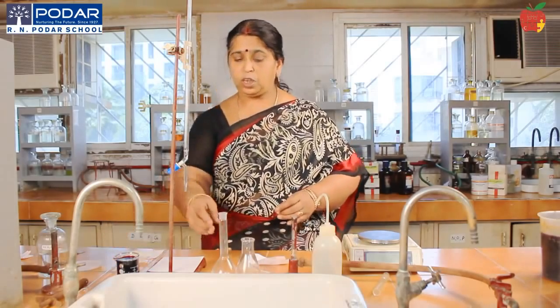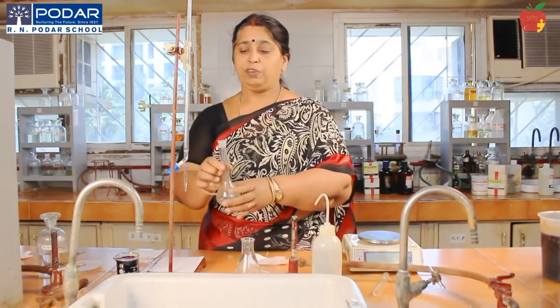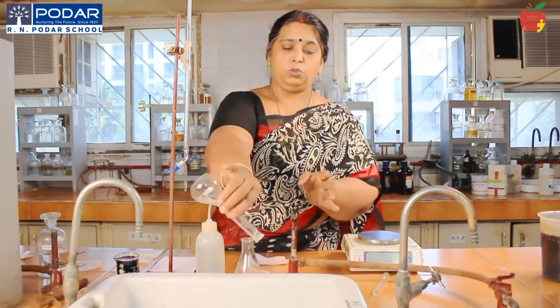Now what should I do? I should prepare the Mohr's salt solution in the standard flask. Before that, I have to wash my apparatus. All the apparatus should be washed before you use. So wash it.